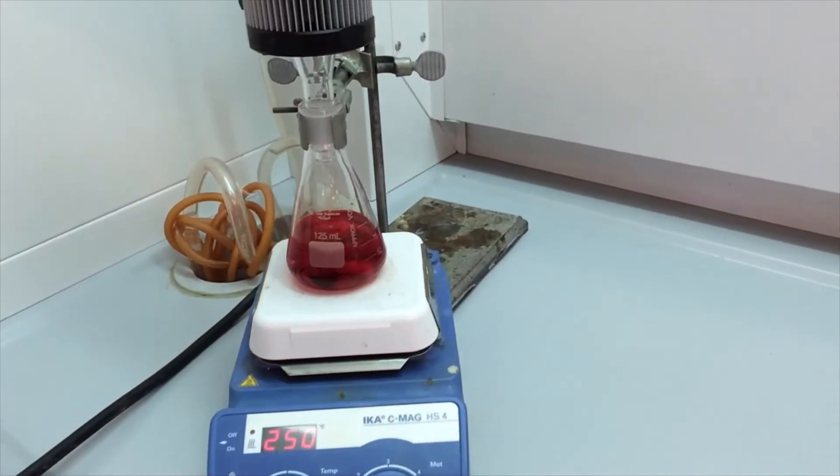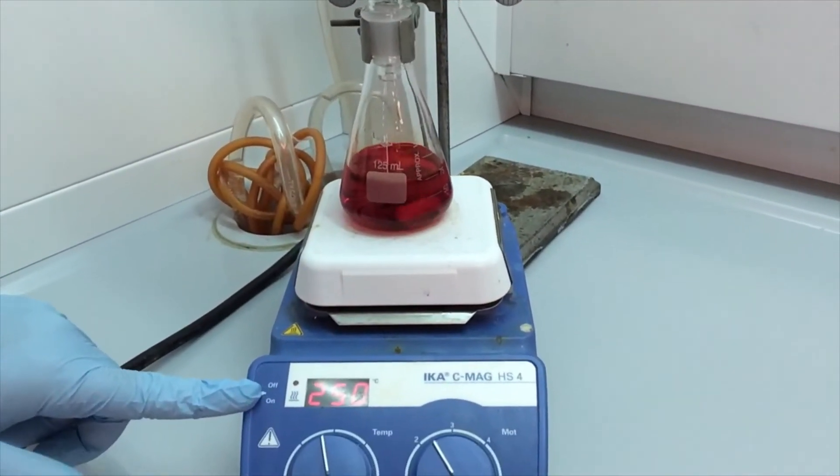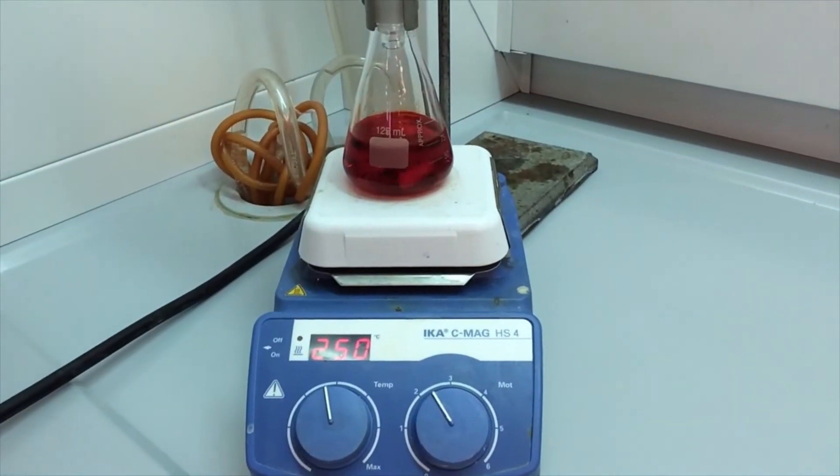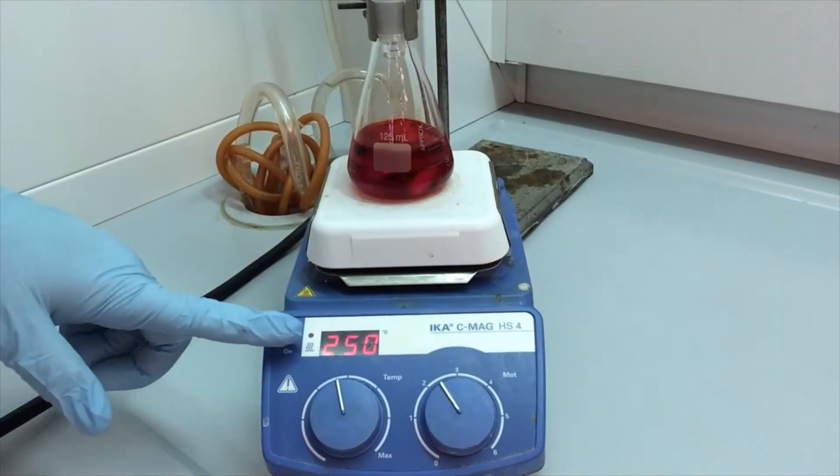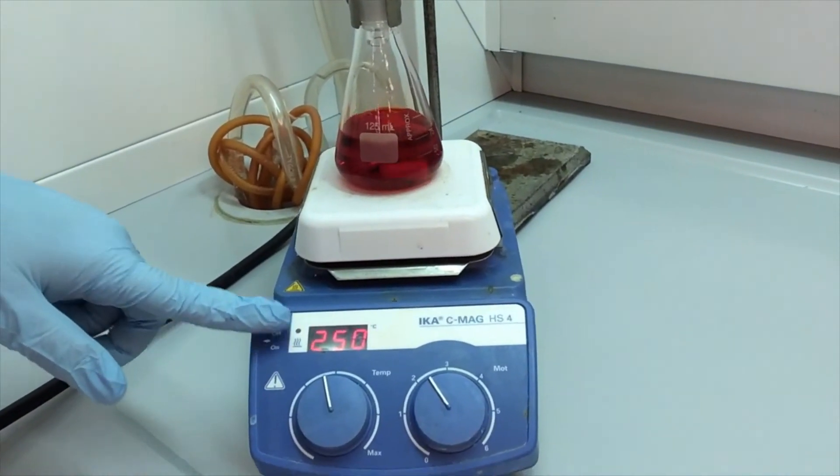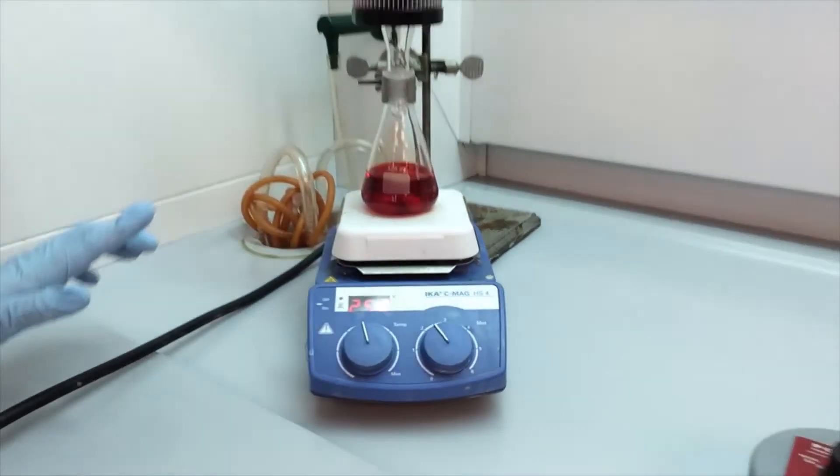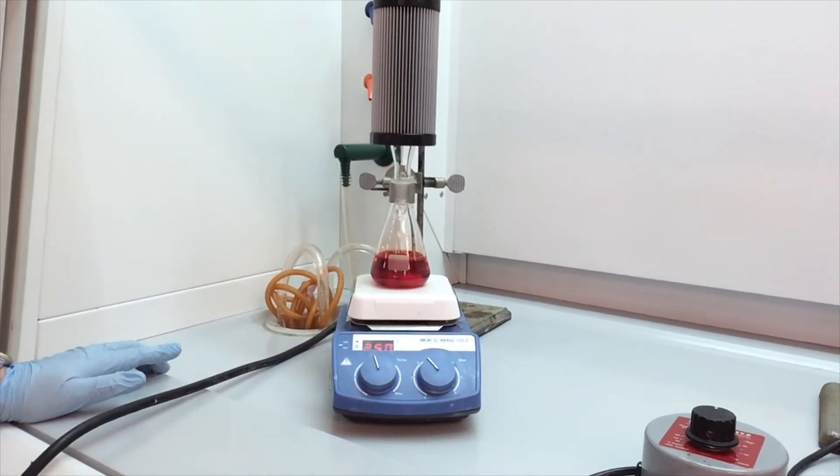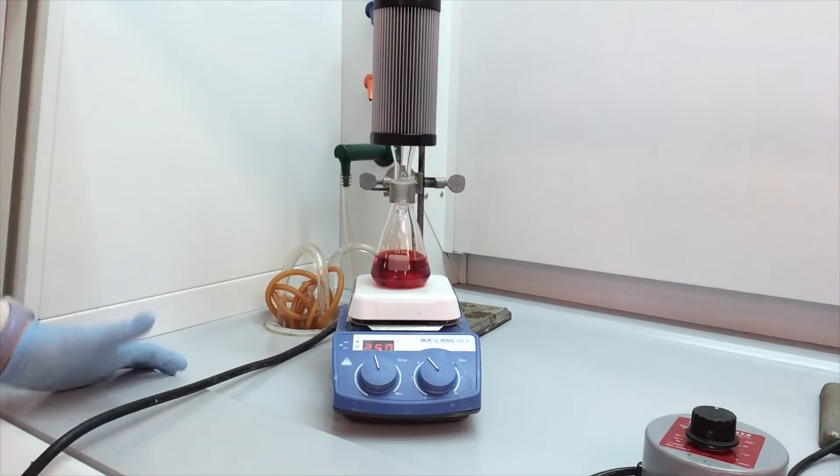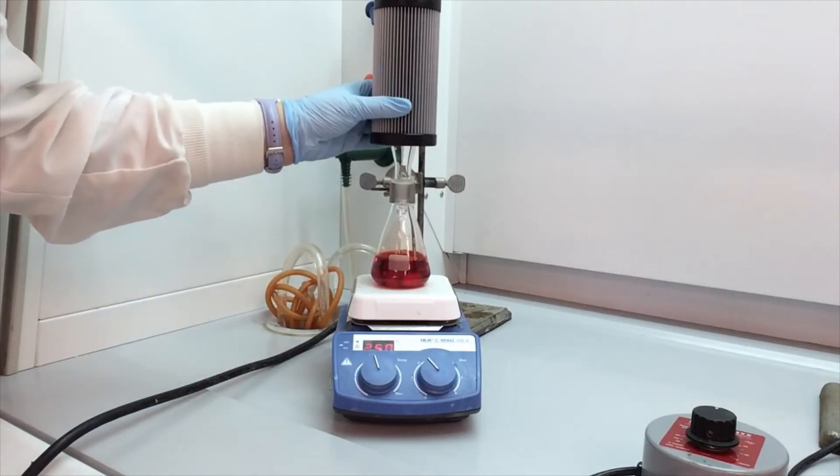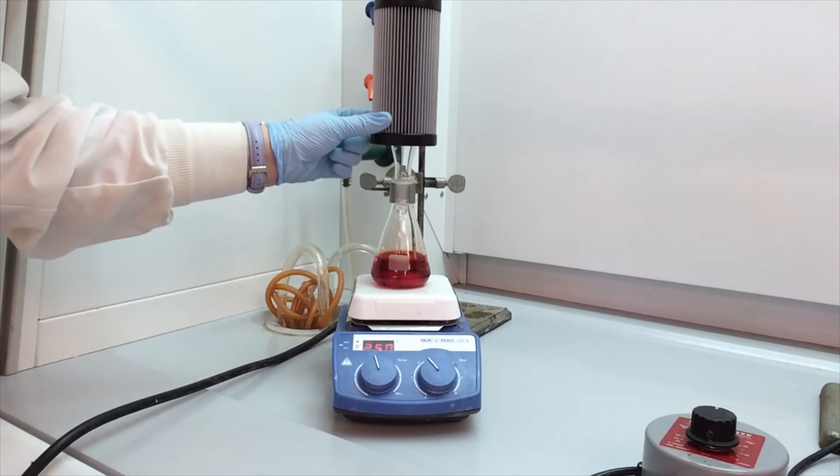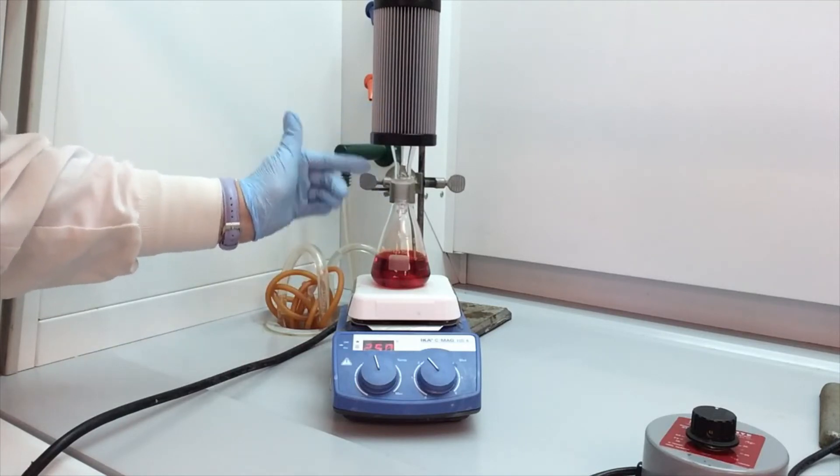And this type of hot plate has a number. It's not accurate. So it's probably likely that this could get to about 125 degrees. So again, this number is not accurate. So then it's just a waiting game. You heat it and then you want to see the same thing. You want this boiling, that vapor will come up, hit the condenser, recondense it back into a liquid and drip down.